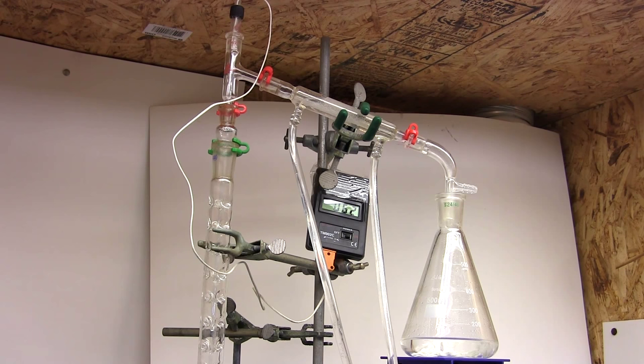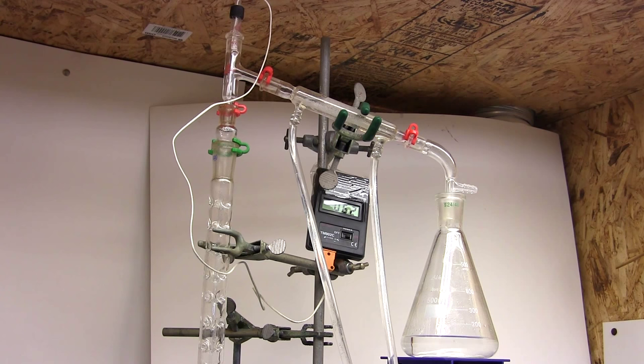Professional distillation setups have very precise and accurate thermometers and extremely efficient columns that can resolve the difference. Anyway I'm not too worried. I'm only interested in getting pure toluene and not the methanol azeotropes.